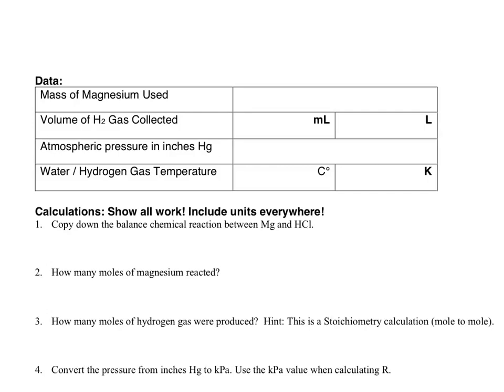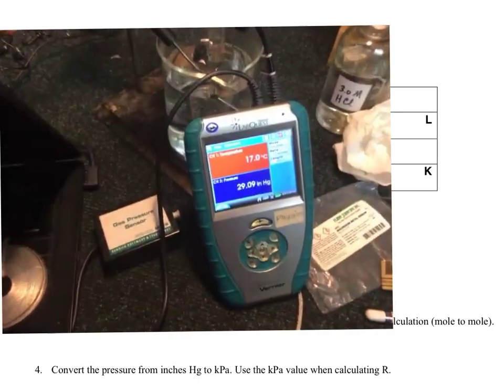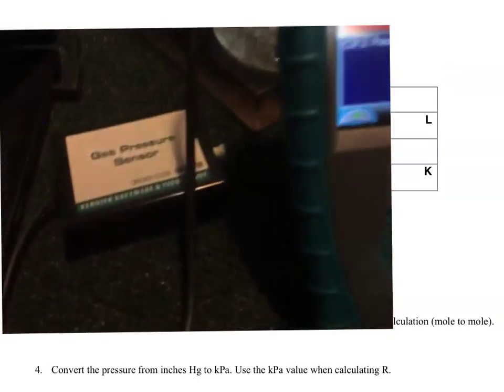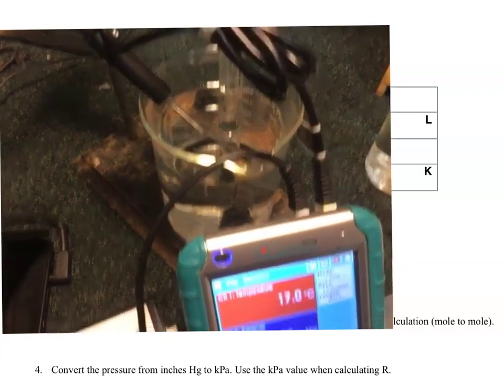Okay, let's record some data here. We have our mass, which we determined to be 0.02 grams of magnesium. Volume of the H2 collected, we'll get that when it's done here. We also need the atmospheric pressure and the temperature. So for pressure, we have our gas sensor, and for temperature, we're going to have our thermometer.